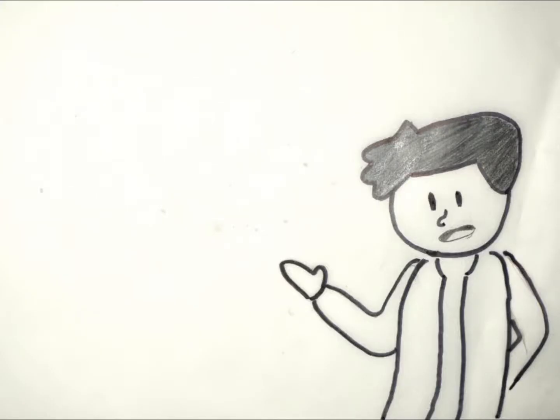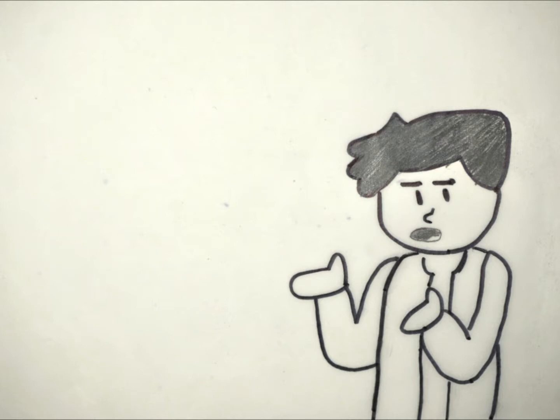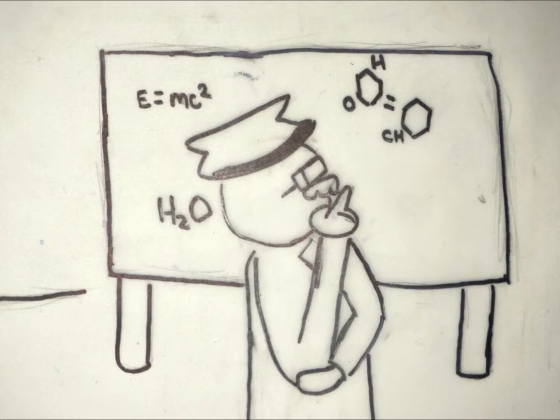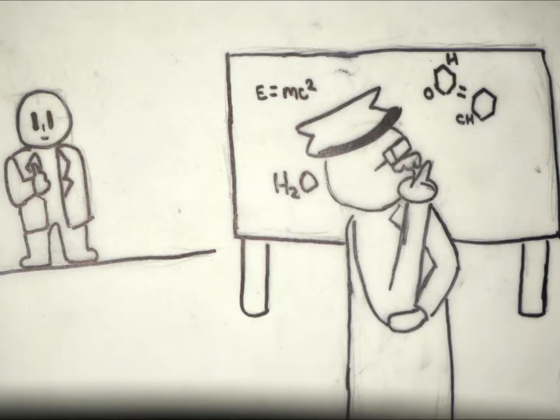Now pause. Keep in mind that the liquid is highly flammable and can make a big boom if not handled properly. The student lighting up the jug was actually the officer of the club. He was the one in charge of correcting our assignments and whatnot because he's got a background in science. So we all sort of trusted him with this.